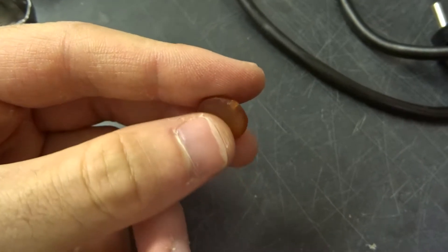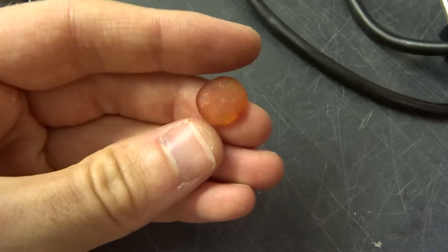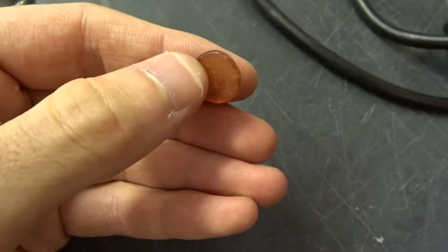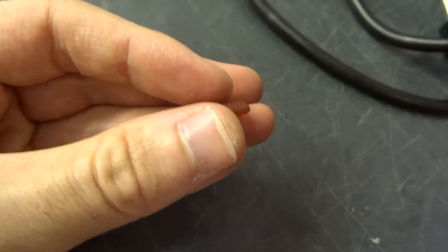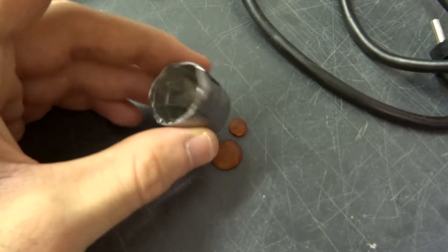They are still soluble in acetone although they have darkened a little bit, they have reddened, probably oxidized in the air. But they still soften when they are heated. Of course I'm going to make a proper video on Bakelite but today I'm just going to test it.